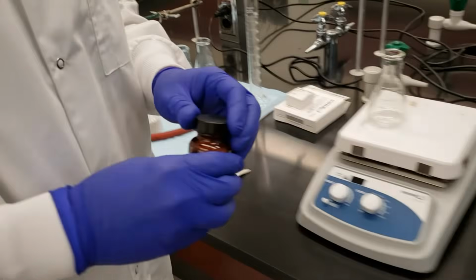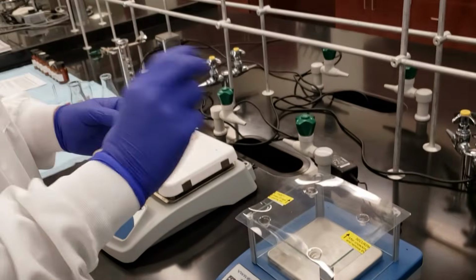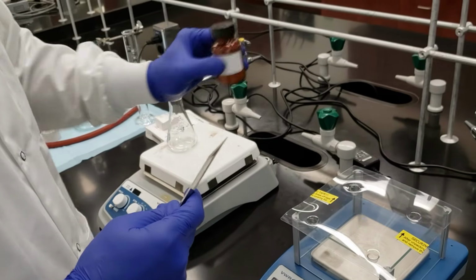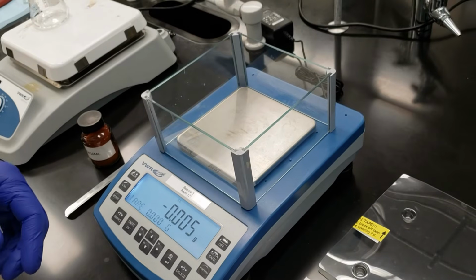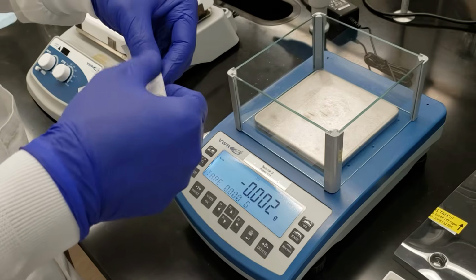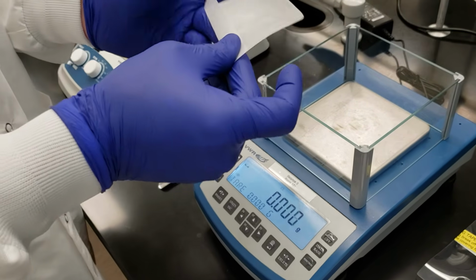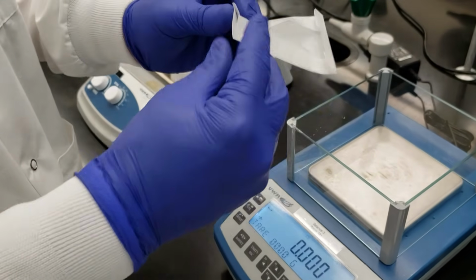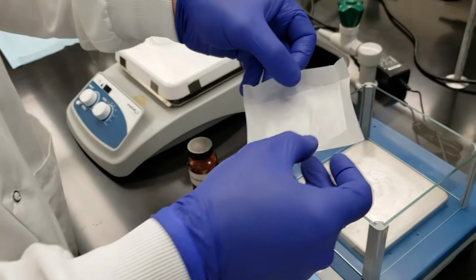We're going to weigh out 1 gram of this heterogeneous mixture. I'm going to mix it up a little bit. Our sand and our pure compound do not mix homogeneously, so we've got to make sure that we get a little bit of both. I'm going to set up my weigh paper so that I can measure this out. I'm just going to fold in the sides to make myself a little dish or boat to make it easier to weigh this out without losing any of my sample onto the balance itself. So now we've got our little catch basin.